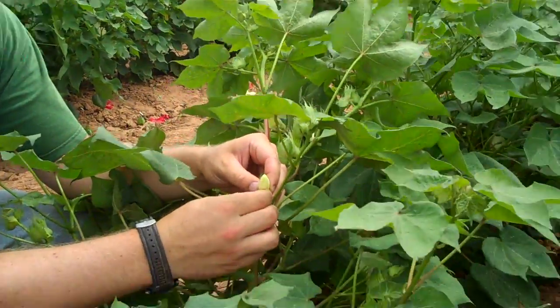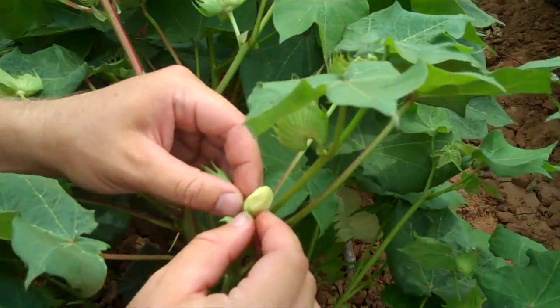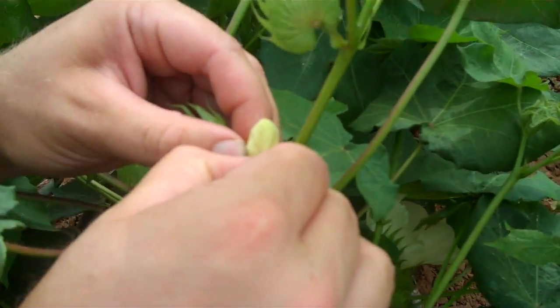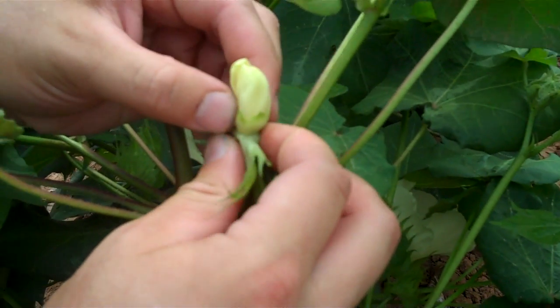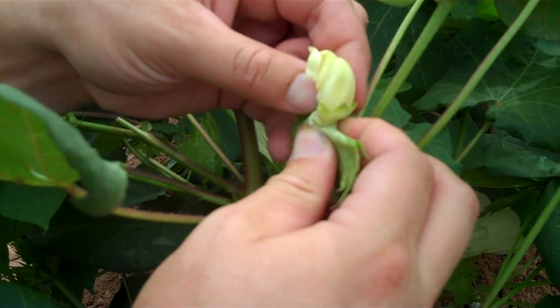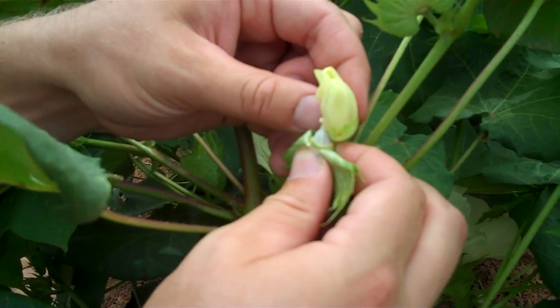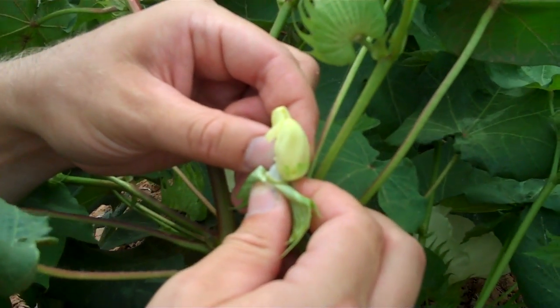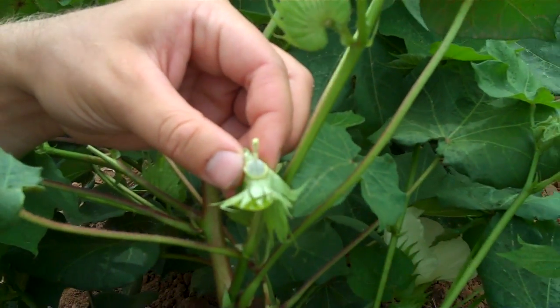So we're going to begin by making an incision between this lower green part and the flower petals. This is to remove the male parts of the flower, so it becomes totally female when we make a cross — then we know we don't have any self-pollination. Once we peel back the lower part and pull it up, we have an emasculated flower.